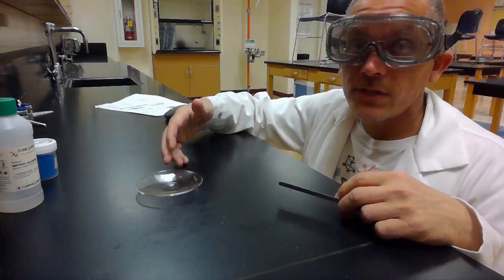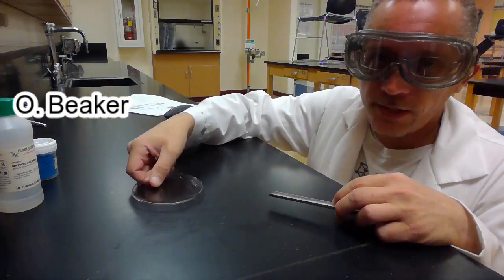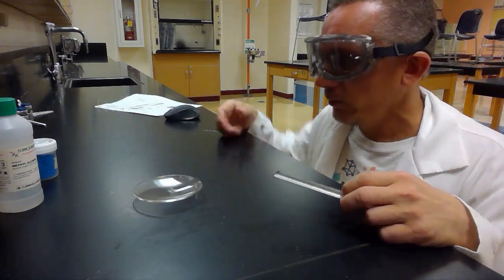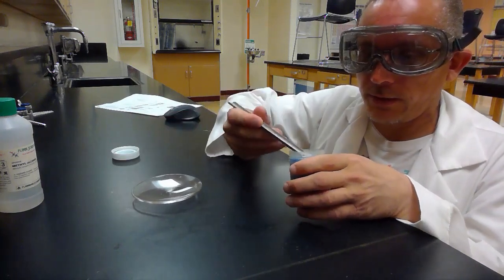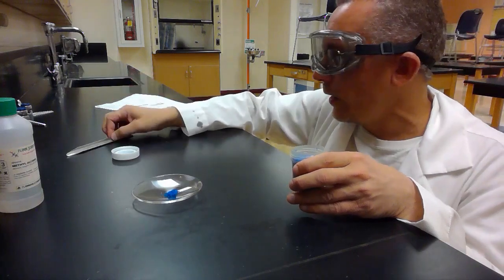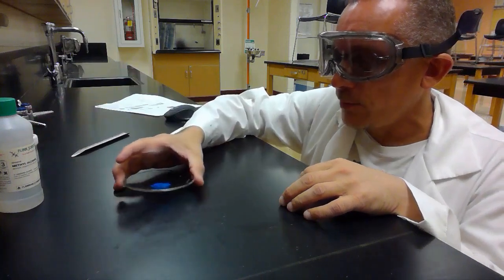Here we can see Picture C. Picture C is what's called a watch glass. You can see it's just a piece of glass. It's like a glass dish, right? It's called a watch glass. And what do you use a watch glass for? Well, generally to kind of watch something. So if I got something like this, I can put this in here and watch it. I happen to like starting fires in them, so you know. This is the watch glass, Picture C.